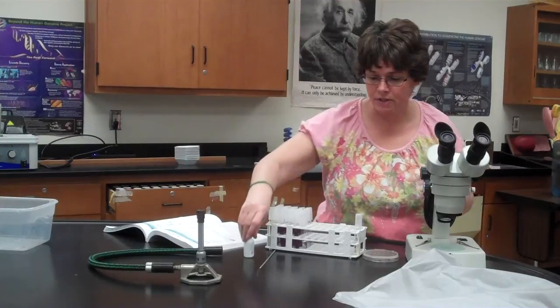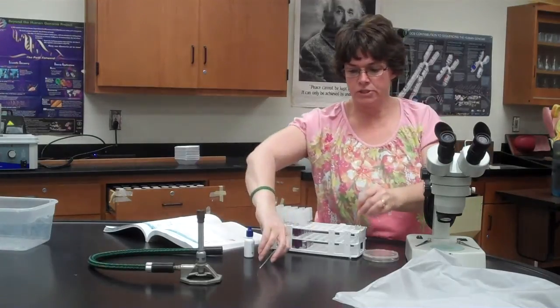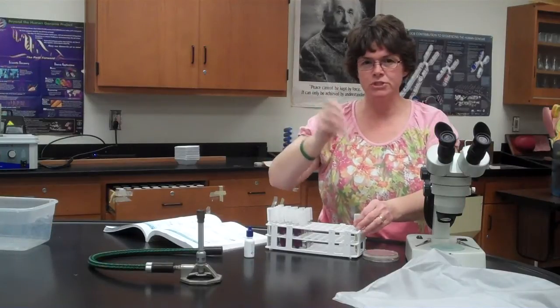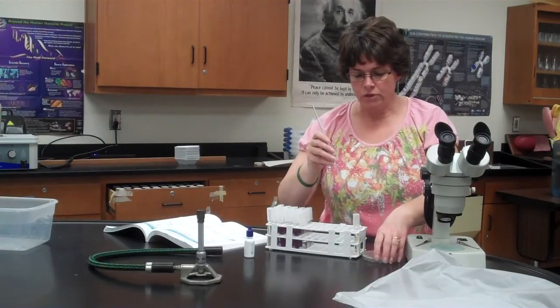So what you're going to do on the first day of the lab, it's very, very simple. First day of the lab, using your sterile technique, you're going to be just taking the fungus. The mold is going to be suspended in a Sabouraud dextrose agar or broth. You're basically just going to go with your loop that's sterile, and you're going to go down and kind of, you may have to push it down a little bit because it might be kind of hard at the top, but basically the idea is just to get some spores. And then you're just going to basically open your plate and you're just going to touch the middle of the plate. You're not going to spread, you're not going to dig down, you're just going to touch.